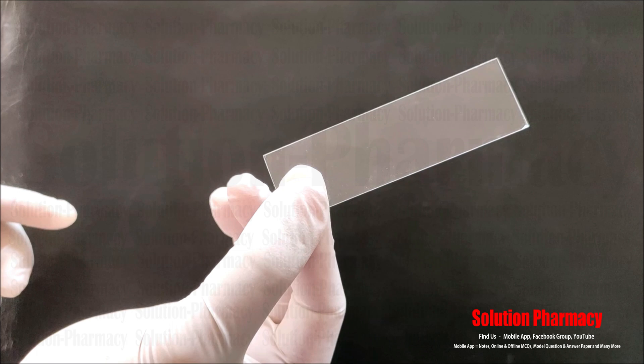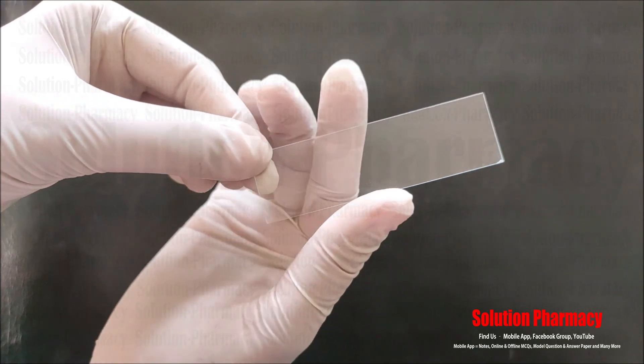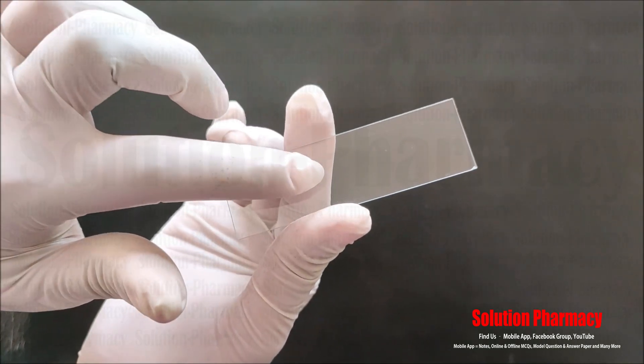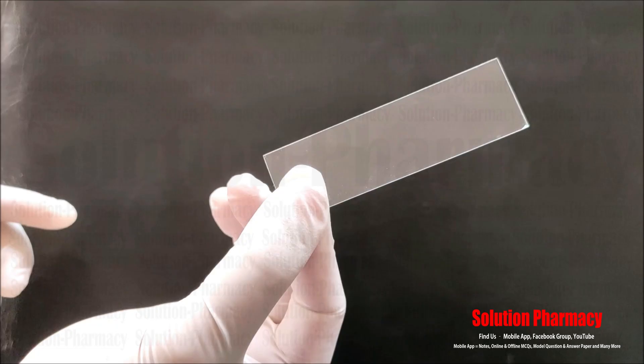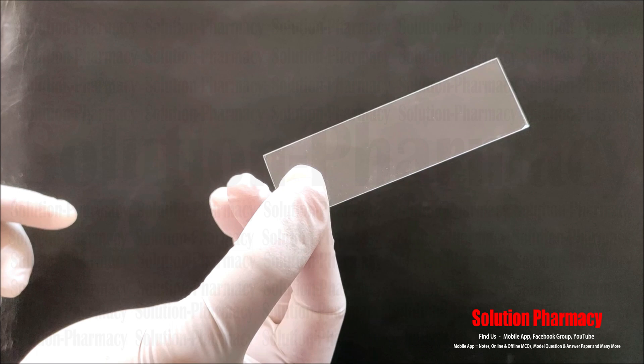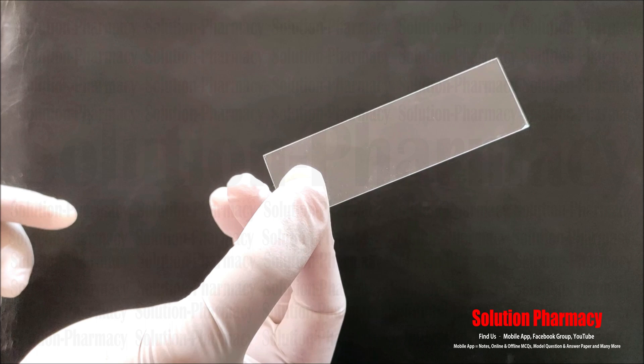Our first glassware is the glass slide, which is also called a microscopic slide. This is a flat piece of glass of rectangular shape, as you can see in the video. As the name suggests, this glass slide is used for the microscopic examination of a sample — we have to place the specimen over this microscopic slide before observation under the microscope.